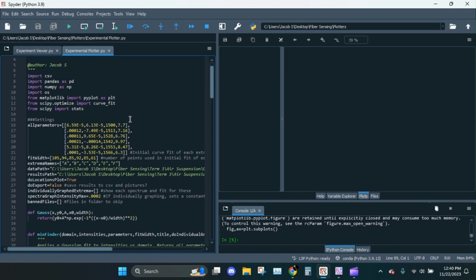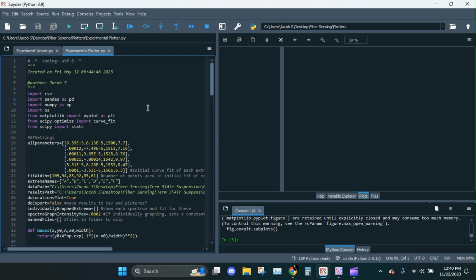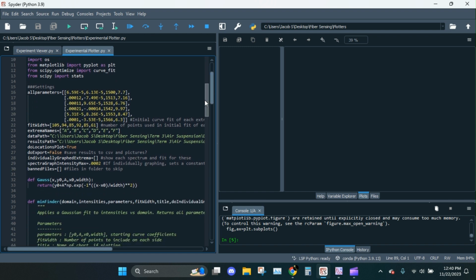Now the first thing, well, let me give you a little bit of an overview of the logic. So what's going to happen here is that for each extrema, we're going to do a first initial curve fit for the very first temperature recording and put all the parameters into here. Okay? What the program does is that it's going to start with this one in the first file, and then it's going to apply a curve fit to that area and get a new set of parameters that tell us where the center is. It'll save where the center is, and then it'll use those parameters as the starting point for the next one. We do another curve fit, save where the center is. That's the parameters for the next one to start with. Okay? Pretty much just loop that for all of the files, for all of the extrema, and then we plot the centers over the temperature.